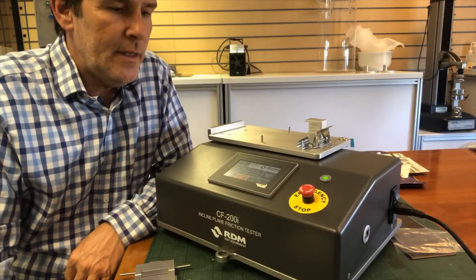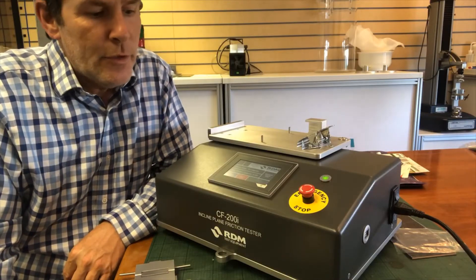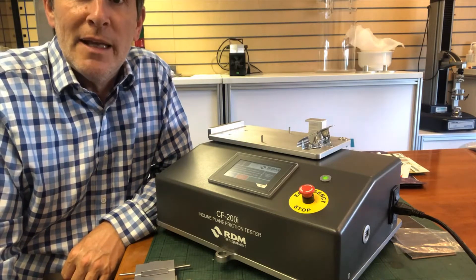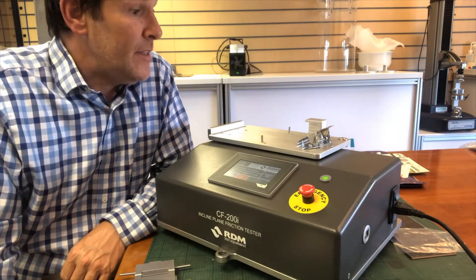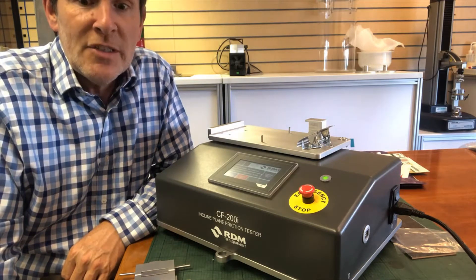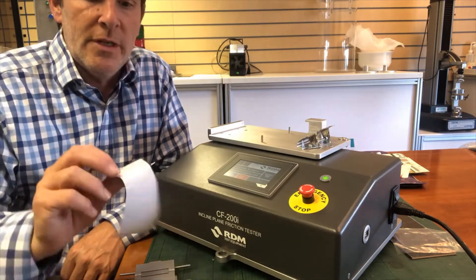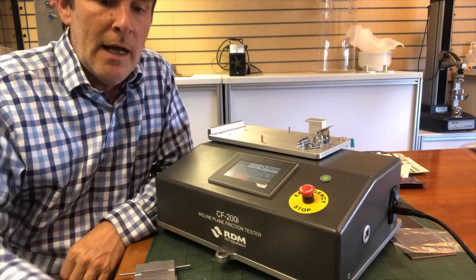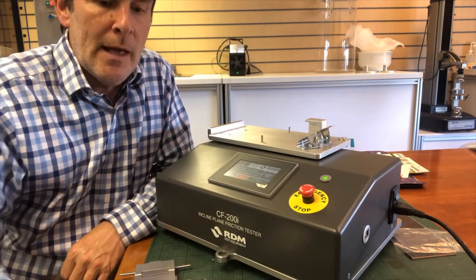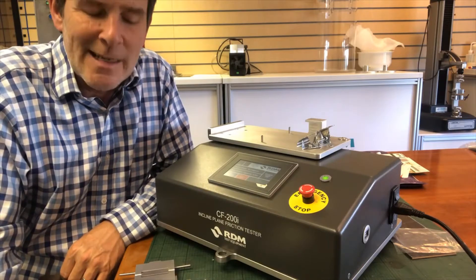This is the RDM Test Equipment CF-200i incline plane friction tester. It's a simple device for measuring the static friction of flexible films, carton board, or other sheet materials that you wish to measure the static friction of.